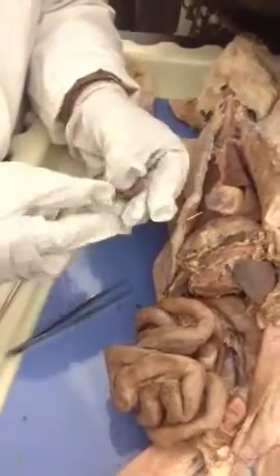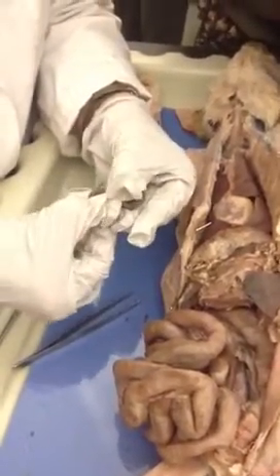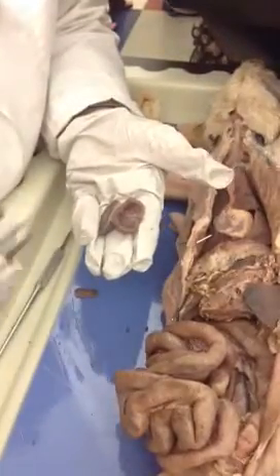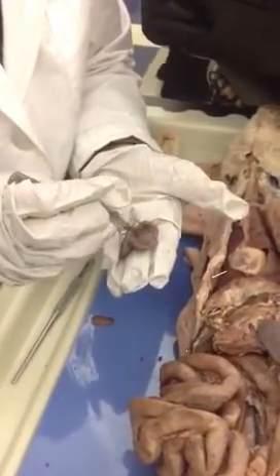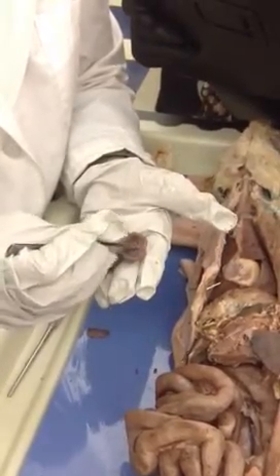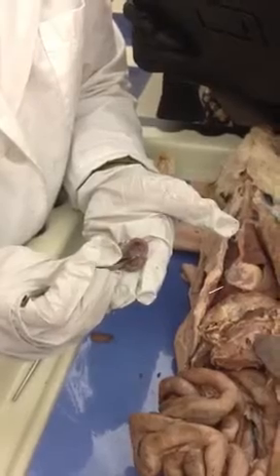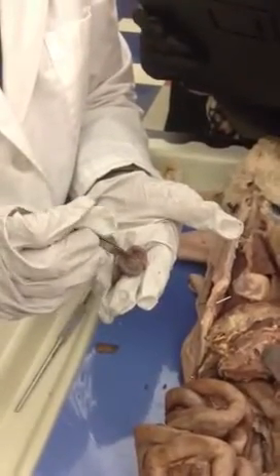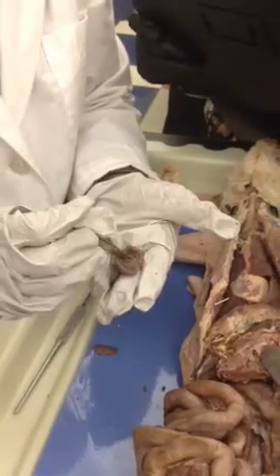And then on the layers and the medulla, we've got three things that you kind of have to know where they are. Okay, so in the medulla, you've got the pyramids, which are the sections of the kidney. So you can kind of see the sections are divided out by these arteries and veins. So each one of these is a pyramid. The entire base portion down here, that's the renal pelvis, so that shiny portion. And then between the pelvis and the pyramid, we're going to call that connection point there the calyx. So pelvis, renal pyramid, and in between at the little arch is the calyx, renal calyx.